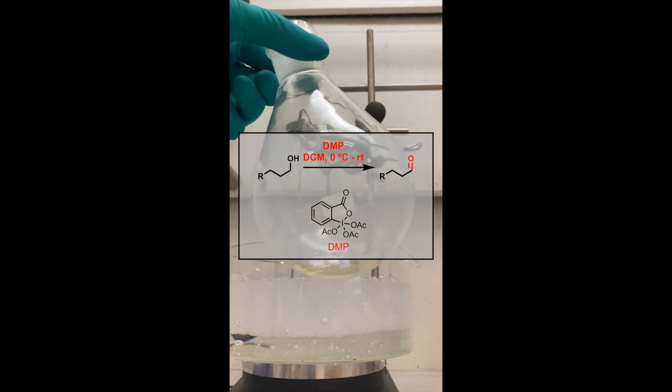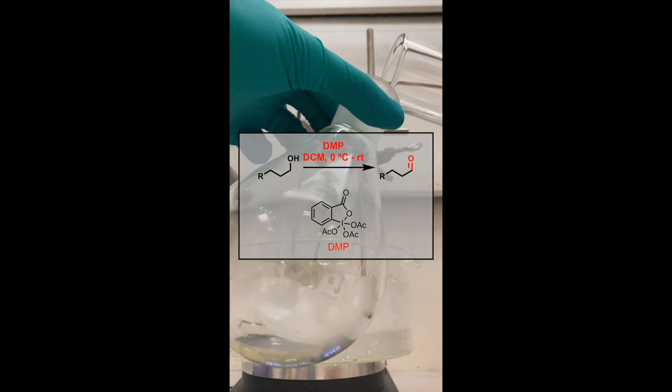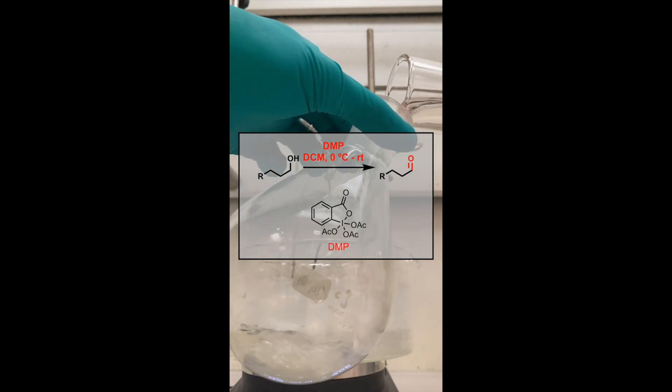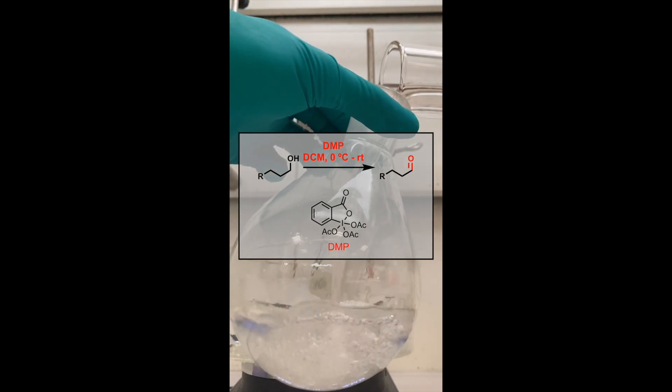I set up an oxidation reaction. In this transformation, I wanted to oxidize my primary alcohol to the corresponding aldehyde.